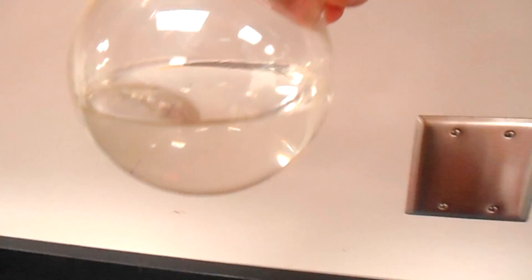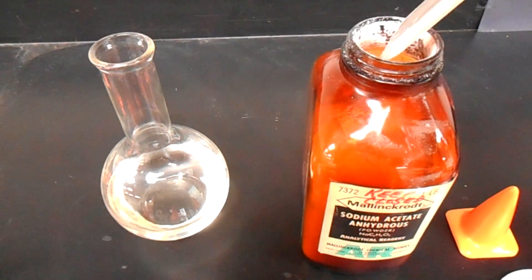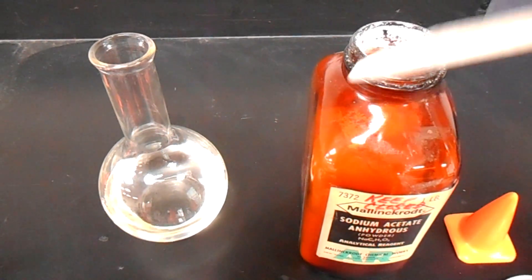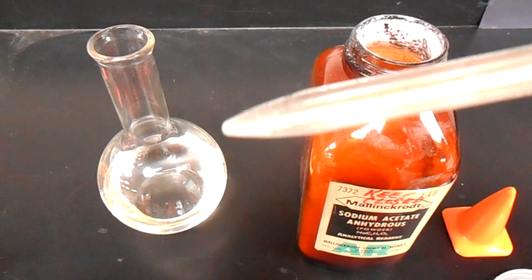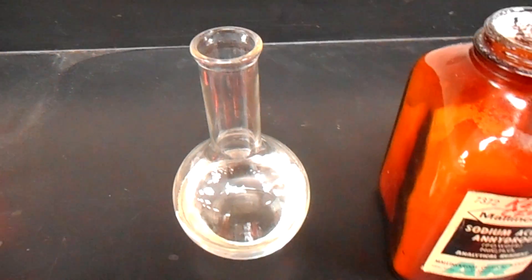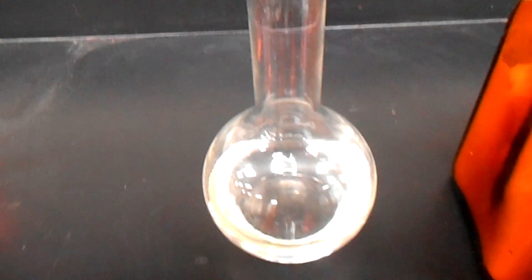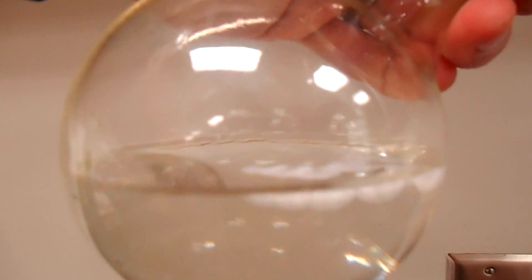Here is a supersaturated solution of sodium acetate. You can see it looks like any other solution — everything in there is dissolved, even though it shouldn't be able to be at these current conditions. If we add just a small seed crystal into the solution, that gives a place for the ions to grow off from that crystal, and all of the dissolved ions will come out of solution, pretty rapidly too.